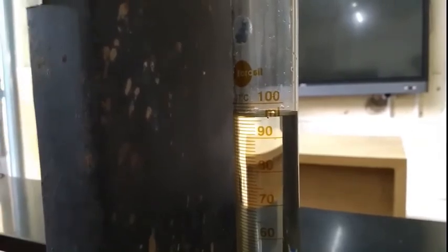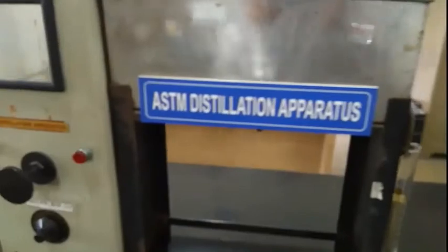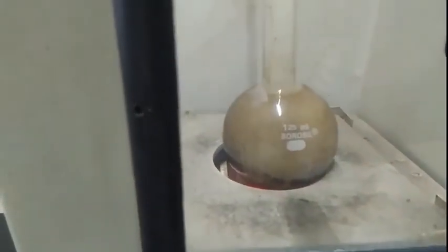As the boiling continues, we get a last drop of liquid. That last drop — the temperature at that point is called the final boiling point.